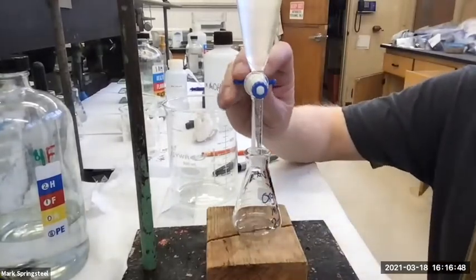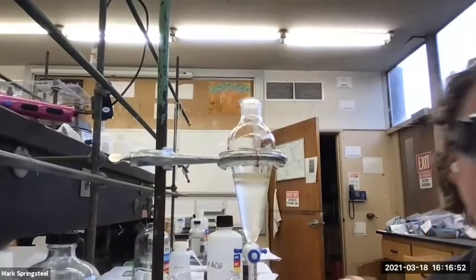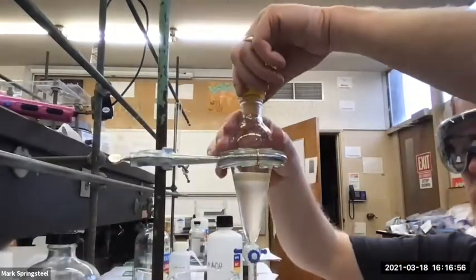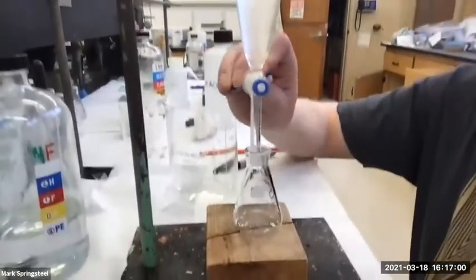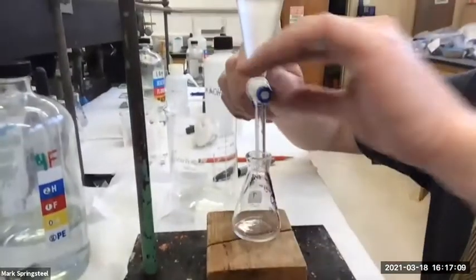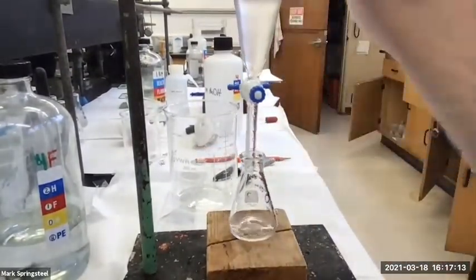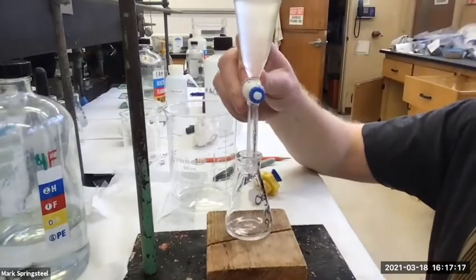Okay, here we go. Oh, and I've taken the cap off. Like I said, we always have to take the cap off. Let me show you something actually. This is a real common mistake. Students will keep the cap on and try to drain the sample, and watch what happens. It just stops. It's because it builds up a vacuum up top. I always have students say, oh, my separatory funnel is broken. It's like, no, just take the cap off. And now it'll drain until you tell it to stop.